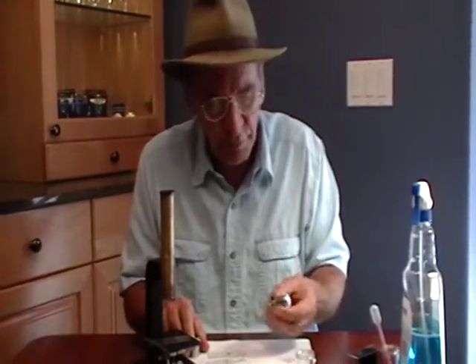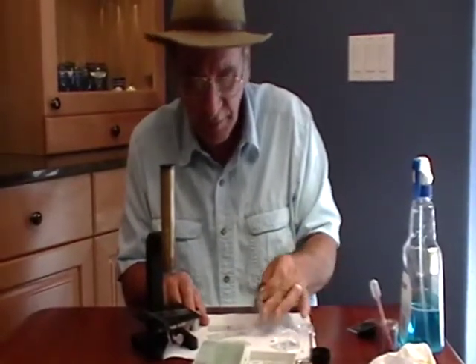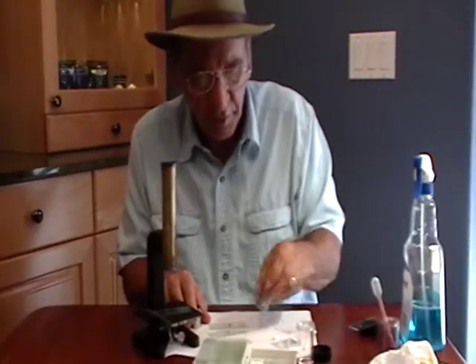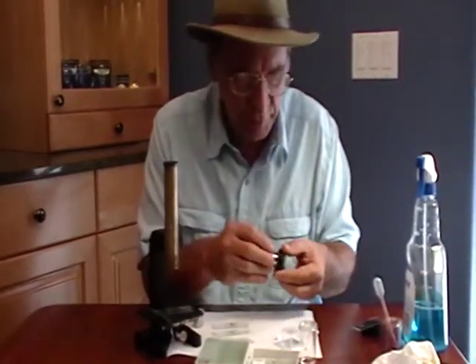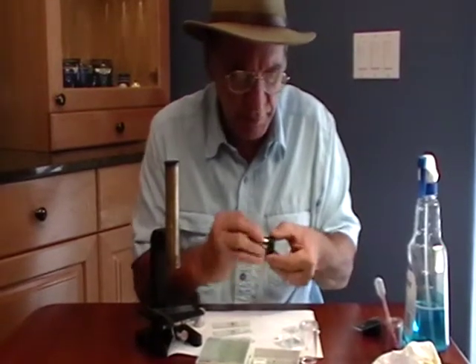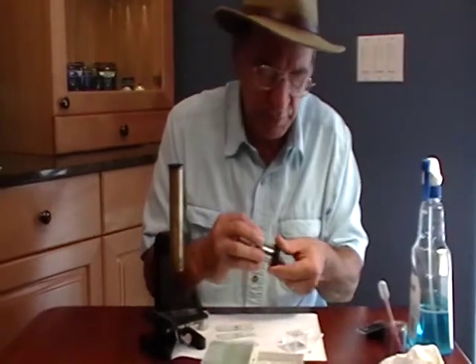See how I put this down here? A real optical person will never put a lens down like that — that's a sign that you don't know what you're doing. So, as is also the case when you're traveling with this or putting it away, use the objective casing that came with it. And if you don't have one, let us know — we have plenty of these and can send you a ton.